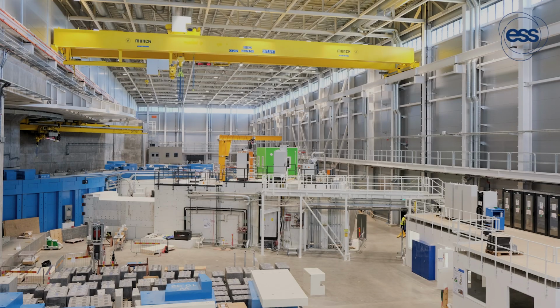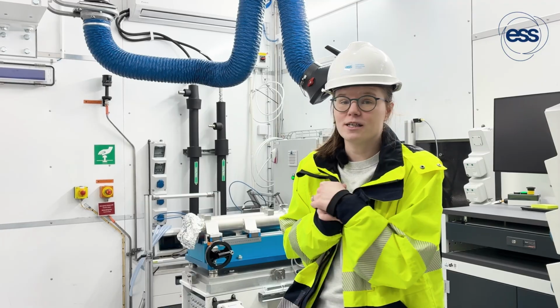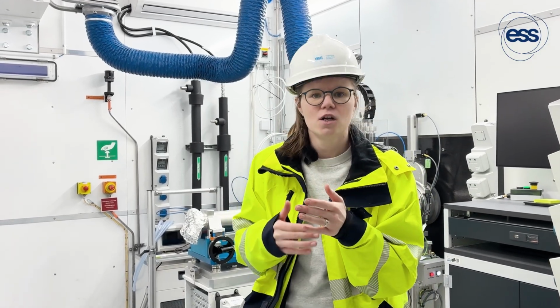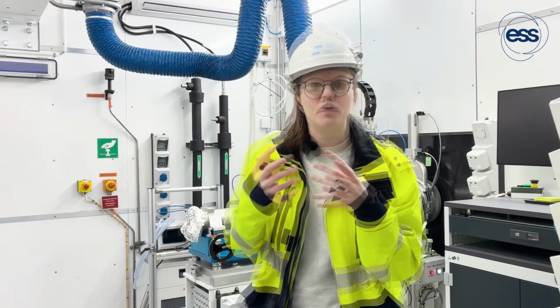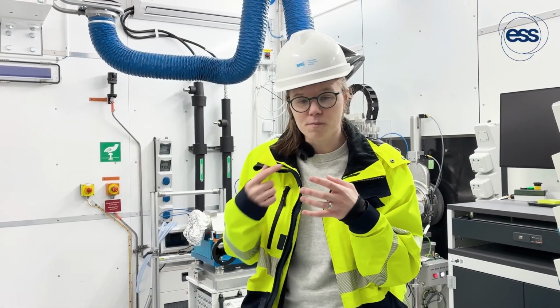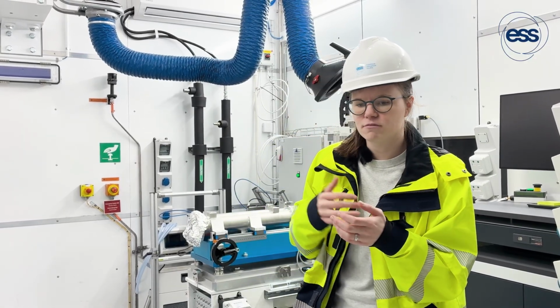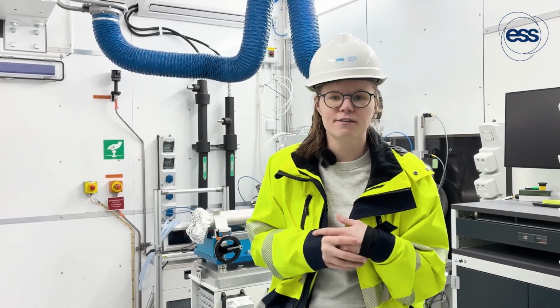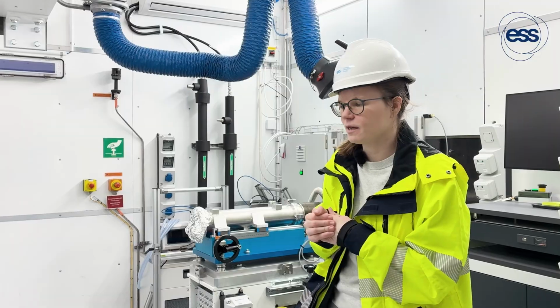Also, because it's a higher flux, we should be able to measure more samples faster. So we expect the beam times to be shorter. We need to work through understanding automation of samples to process a lot more, which hopefully means that we can get users their data faster, ideally high quality data. So for weakly scattering samples, we should be able to get more statistics on them.